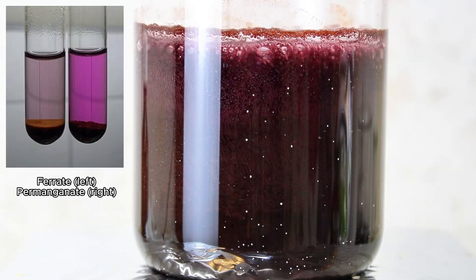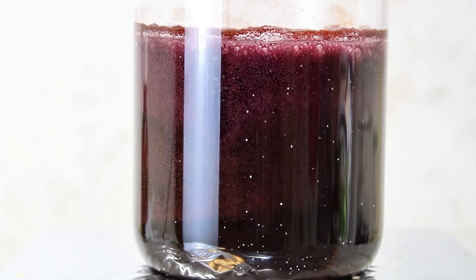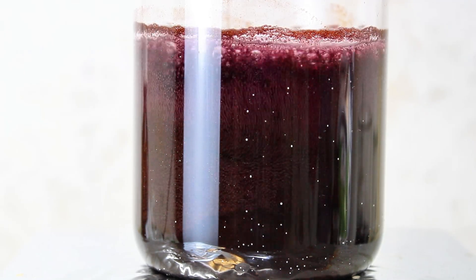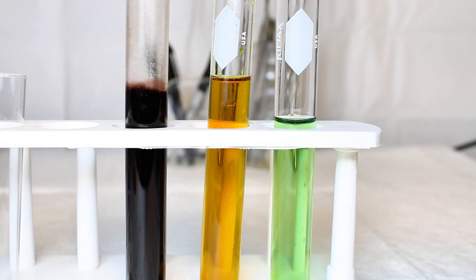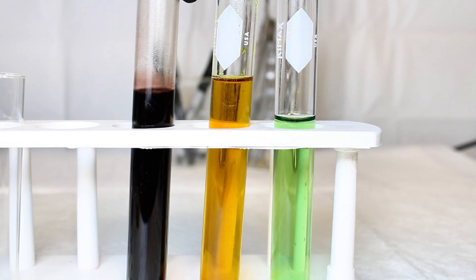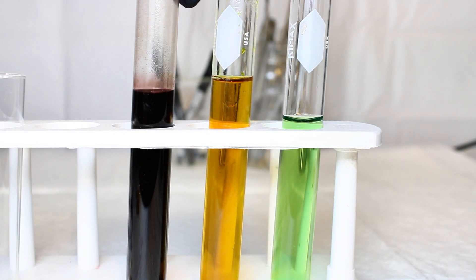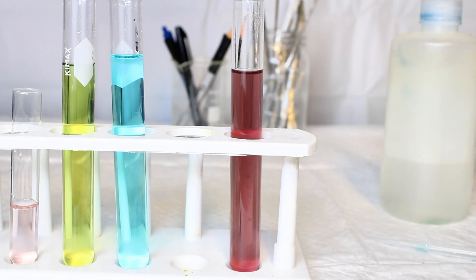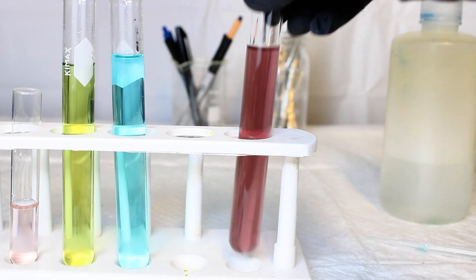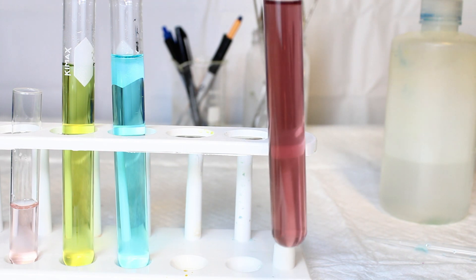Now, I tried to show my sample of sodium ferrate alongside the +2 and +3 samples, but it's really concentrated and too dark to really see the color, and it decomposed when I tried diluting it. Eventually I figured out that it could be diluted with a 5 molar sodium hydroxide solution, and so here you can see the color a lot better.